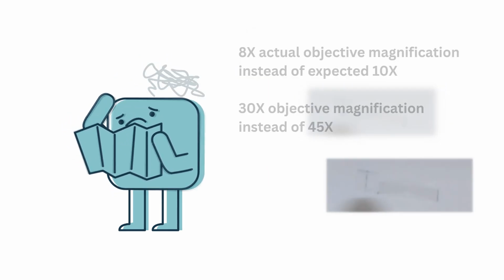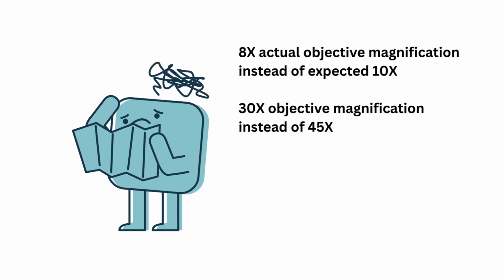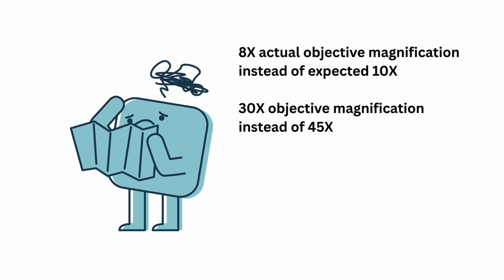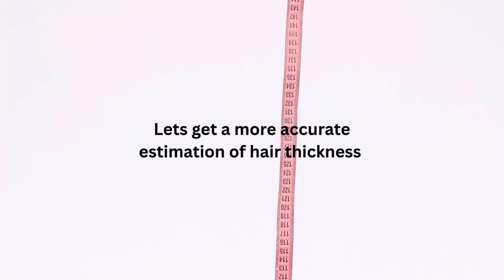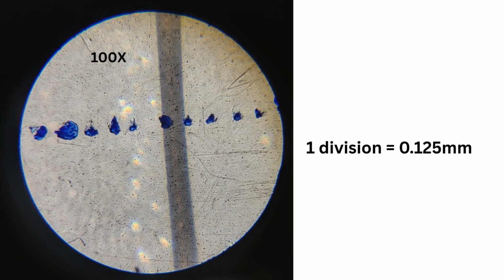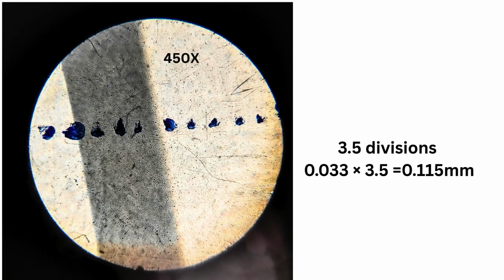I was disappointed and I made 3 graticules, just to be sure, but got similar calibration every time. So the 10x objective of microscope is perhaps magnifying 8x and the 45x objective is giving effective magnification of 30x. Now, using our more accurate estimate, width of the hair is calculated to be 0.125 millimeters under 10x or 0.115 millimeters under 45x.